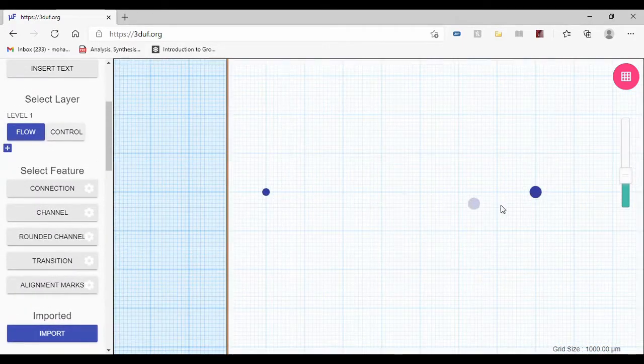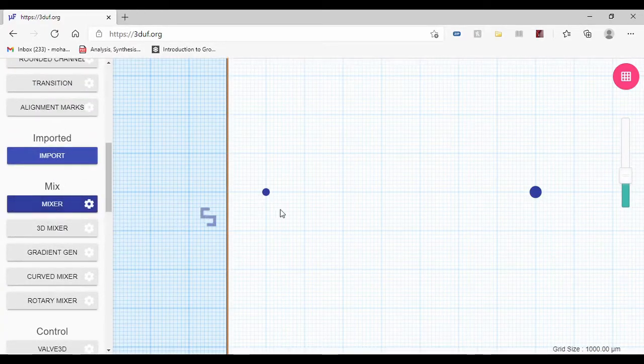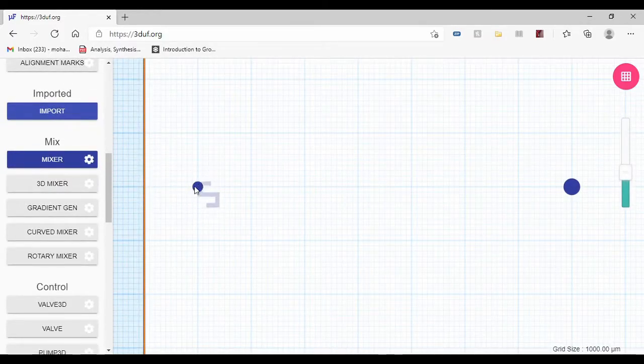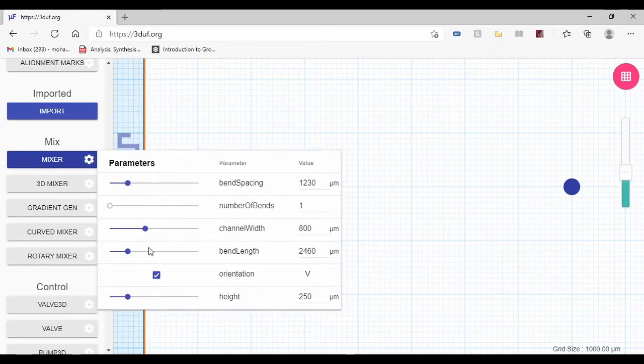And then I want to connect these two ports with a mixer. I have the mixer here. The mixer basically takes the collected fluid in this port and mixes it up, if it was a combination of different fluids, and then it connects this port to the other one. I can see that the mixer is vertical, so I need to change it to horizontal by going into the settings and unchecking the orientation.